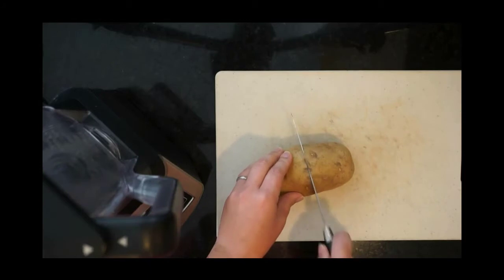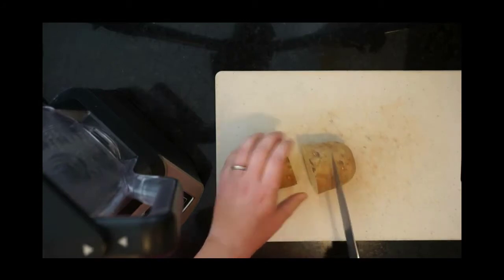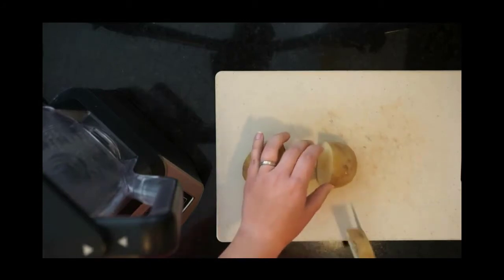You'll start by cutting your potato into about one-inch cubes.